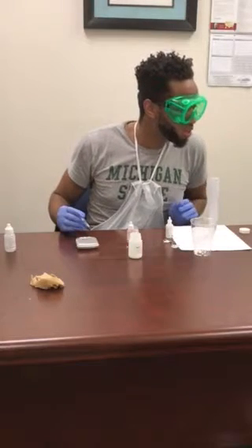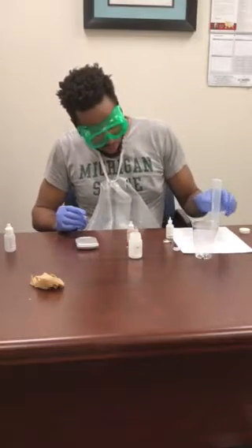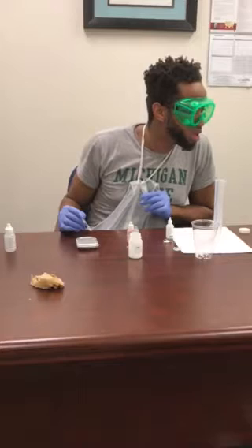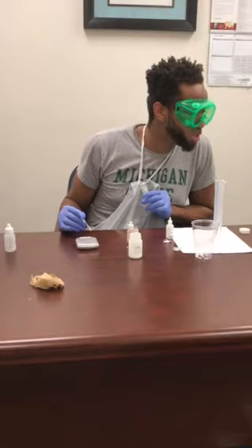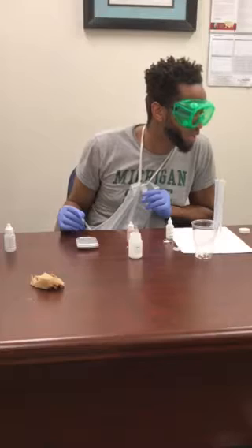So what did you want us to do with a piece of paper again? Place the flask containing the 5 mL calcium hydroxide on the white sheet of paper. So it's this one, right? Yeah. Place the flask. The white background will make the color change more noticeable. Okay, add HCl dropwise from the syringe to the flask, swirling, until a single drop of HCl causes a color change that persists for a few seconds.